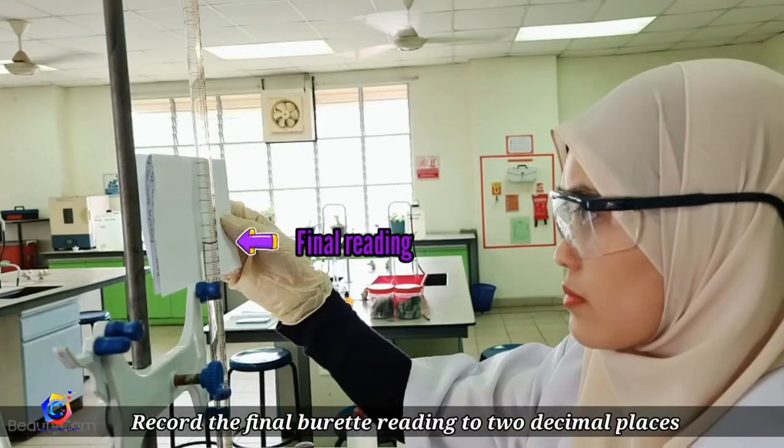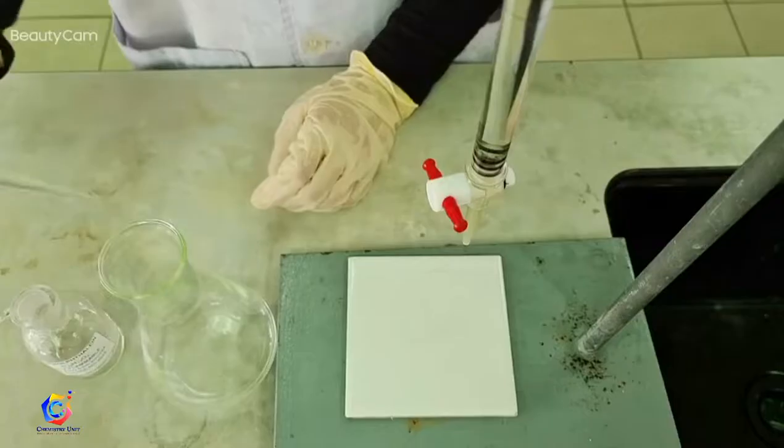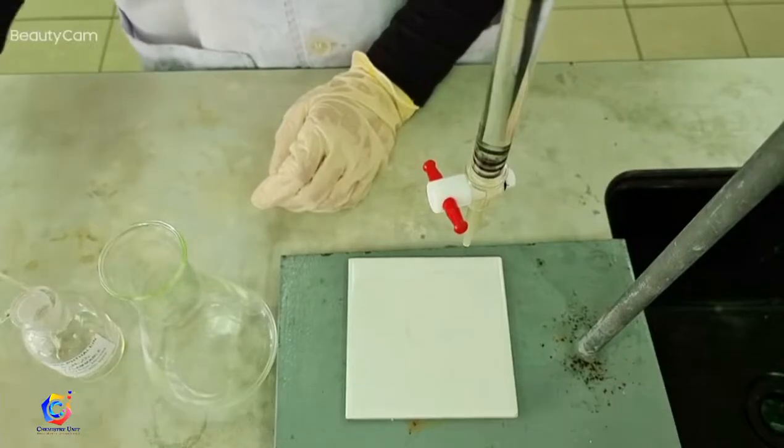Lastly, repeat the titration with sample 2.